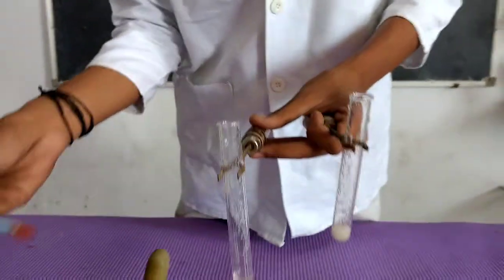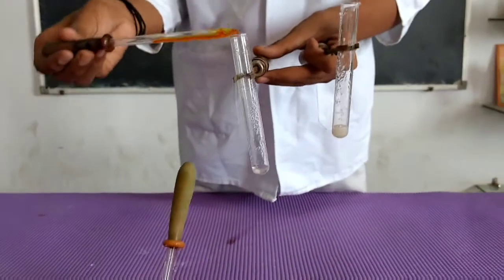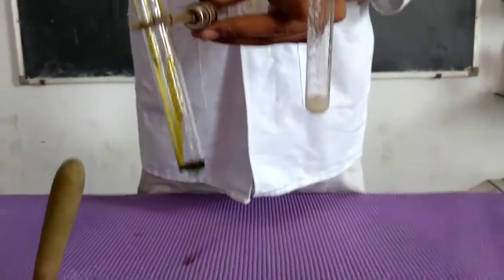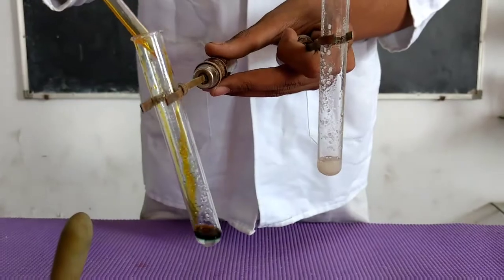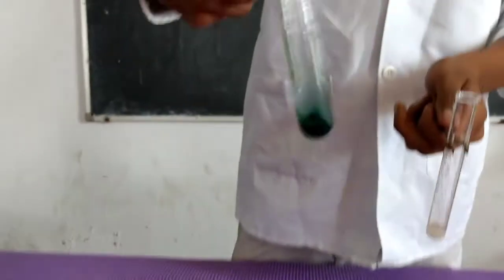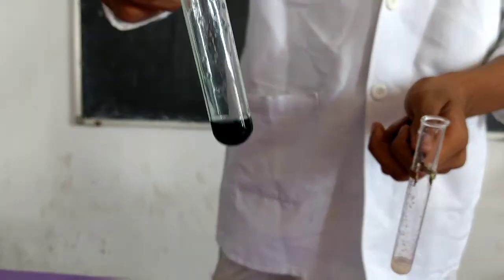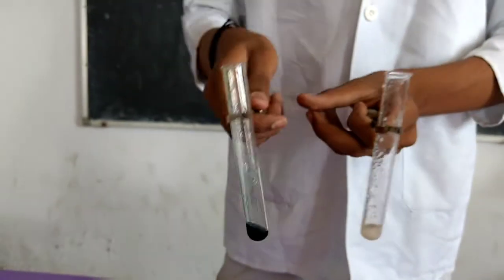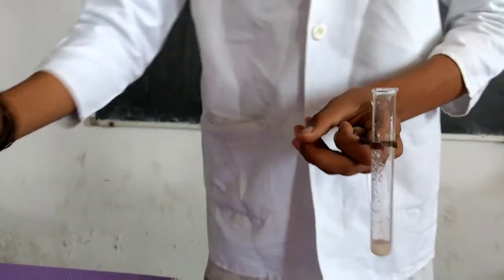Now, in the first test tube, he is adding potassium dichromate solution. As you can see, the colour of potassium dichromate has changed to green.